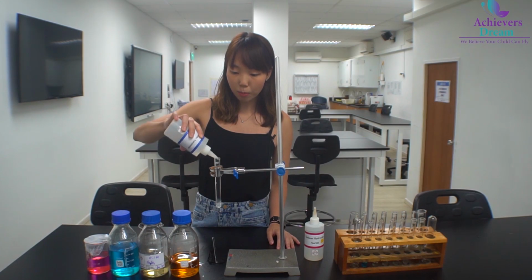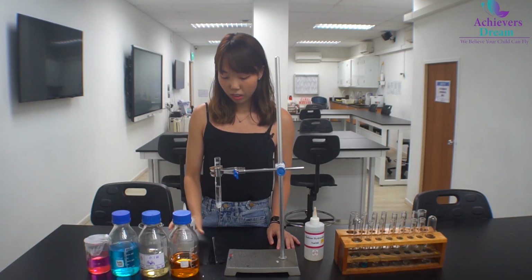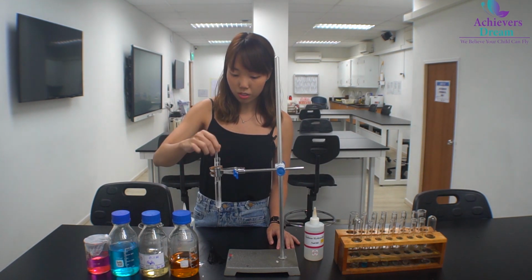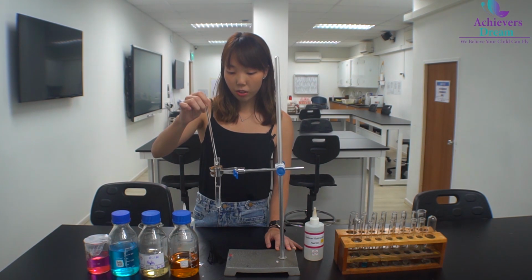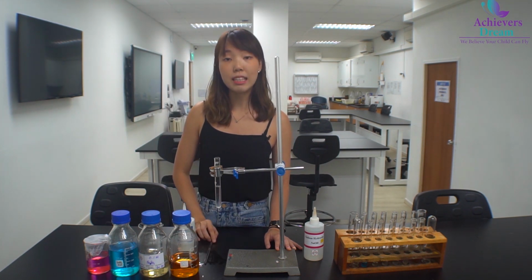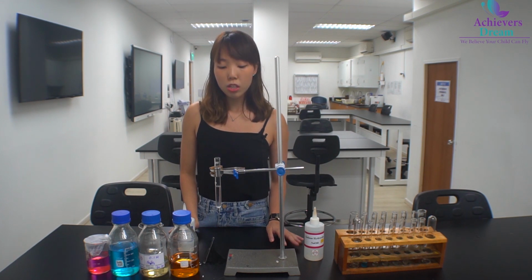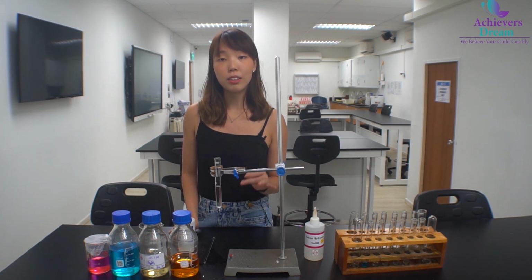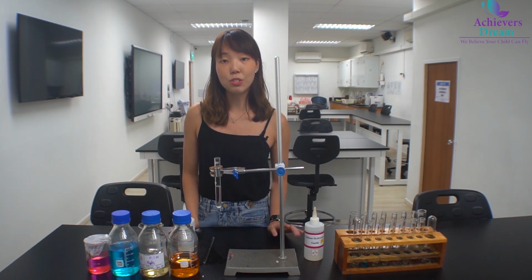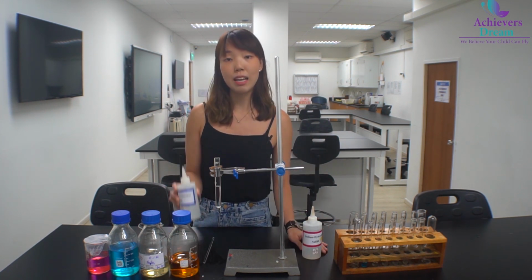So next, I'm going to add in excess aqueous ammonia, and I'll be using a glass rod to stir. As you can see, the white precipitate dissolves in excess ammonia to form a colorless solution. So among the three cations, zinc, aluminium and lead, zinc is the only cation that will form a white precipitate that dissolves in excess aqueous sodium hydroxide as well as aqueous ammonia.